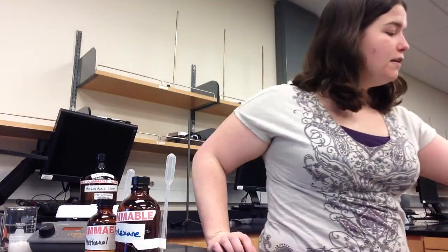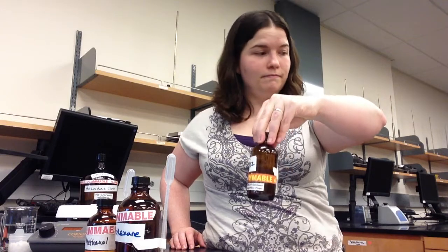before leaving lab today. In addition to two of our solvents being flammable, some of the unknown liquids themselves are flammable too. They say so right on the bottle. So be extra careful. Because the unknown solids and unknown liquids are unknown, you do not know what the substances are. So you don't know what properties these substances have.